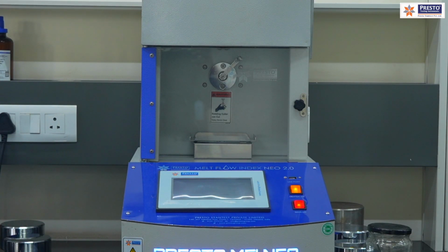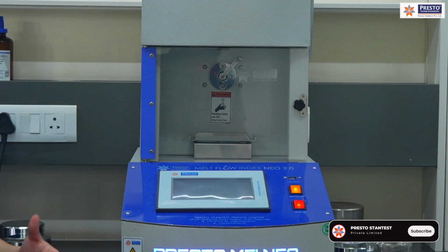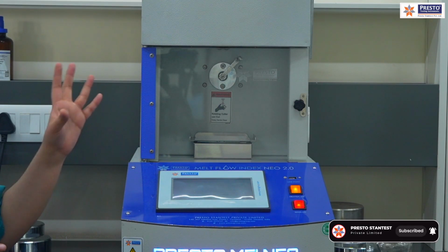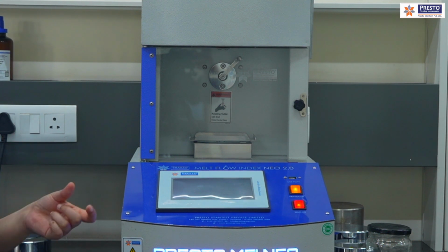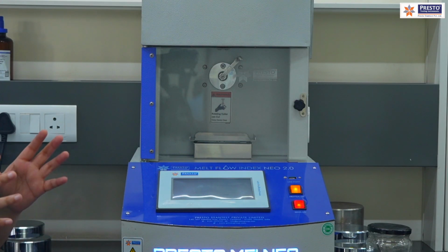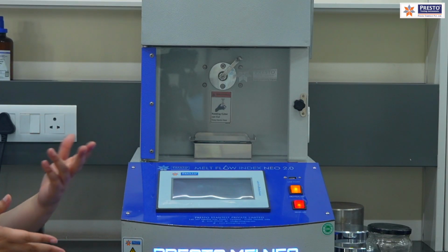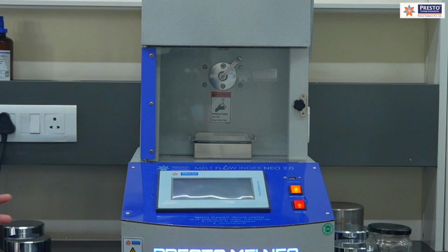First of all, the purpose of melt flow index tester is to check the melt flow rate of the sample, that we all know. The advanced features here will be having that it will automatically detect those results after we will feed the sample, which will help the molding industries, the injection molding, to apply the temperature, time or the pressure parameters perfectly as per the grams per 10 minute, the flow rate of the sample. So that's why, to check the quality of the granules, mainly the polymers, this particular equipment is used.